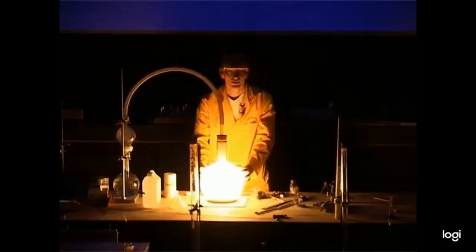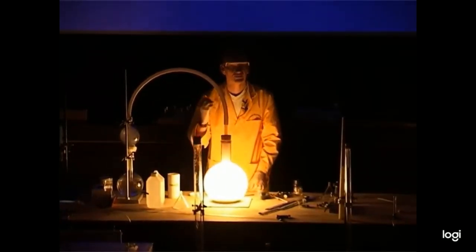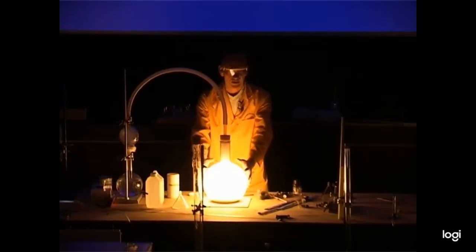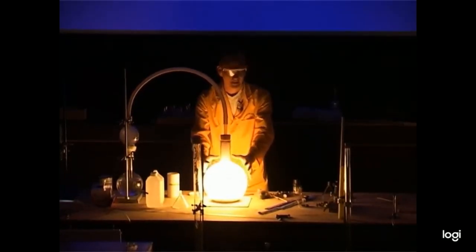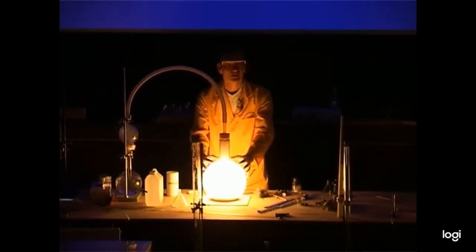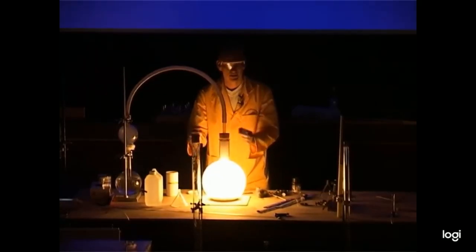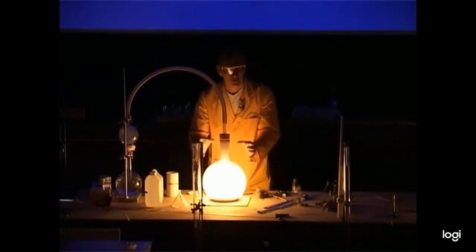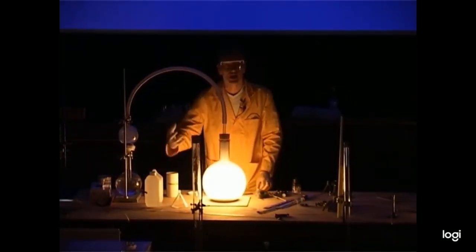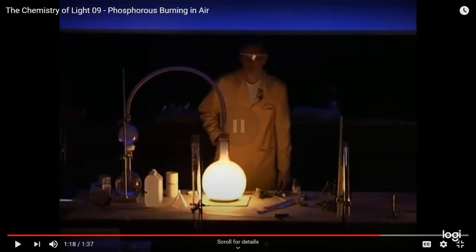The light that we see here now is the reaction between this very reactive phosphorus burning with the oxygen that's in the air inside this flask, and it's making phosphorus oxide. This is a chemical reaction, but this chemical reaction is giving out light as well as heat.